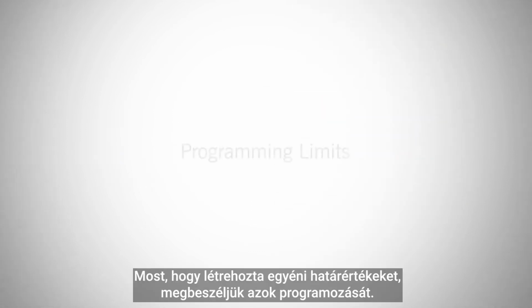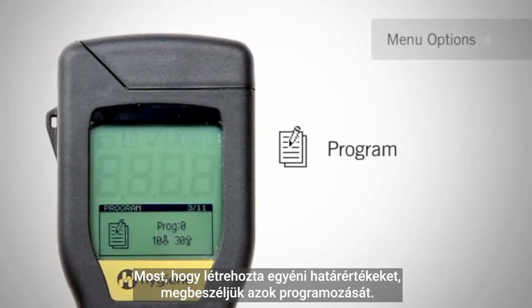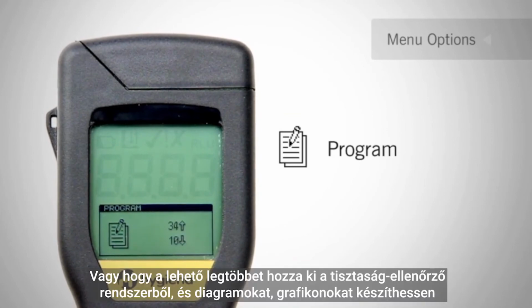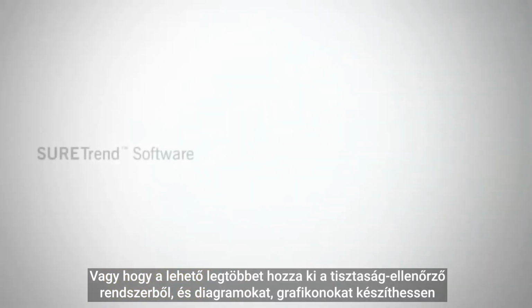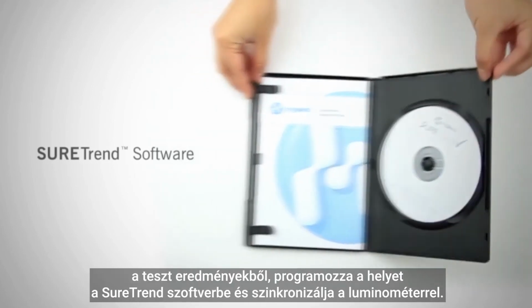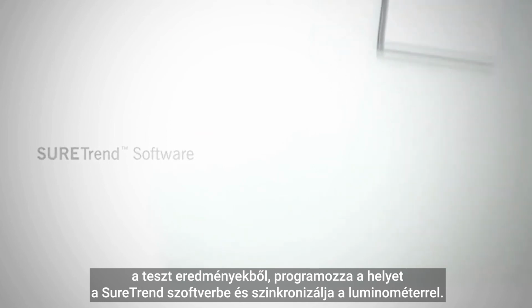Now that you've established your custom limits, we will discuss programming those limits. You can manually adjust the pass-fail limits on the instrument through the menu option Programs. Or, to get the most out of your monitoring system and be able to run charts and graphs with your test results, program your locations using SureTrend software and sync to your meter.